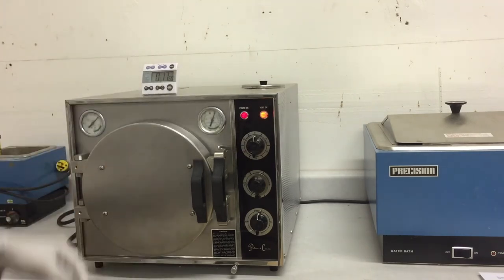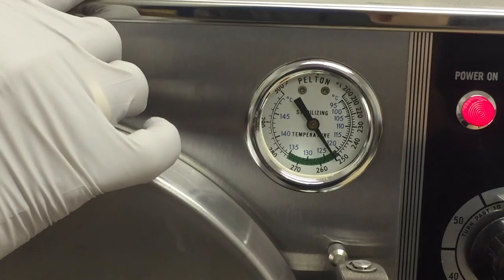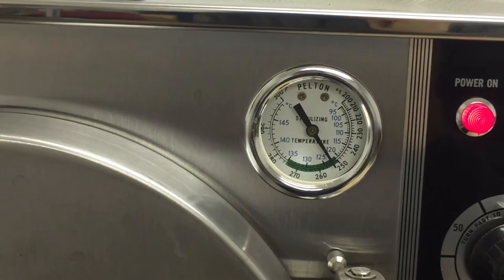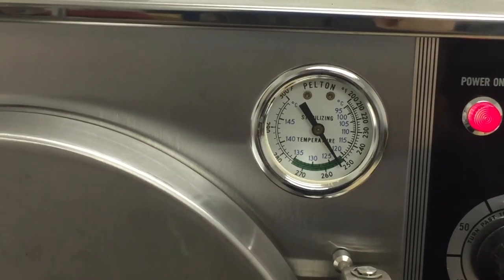Stage 1 will take approximately 10 to 15 minutes for the chamber to reach 250 degrees Fahrenheit. During stage 2, the chamber is maintained at 250 degrees Fahrenheit for 15 minutes.